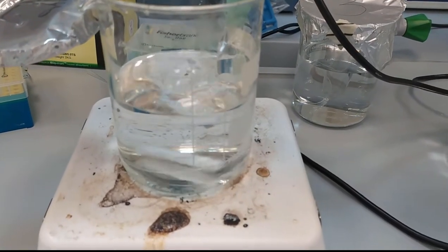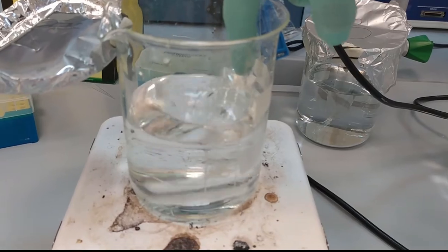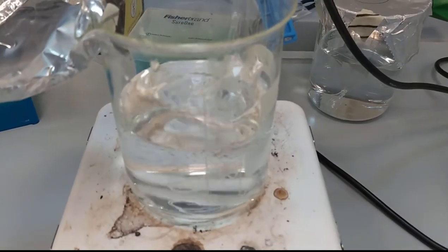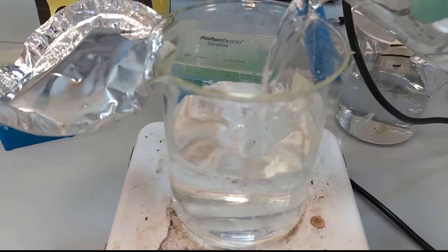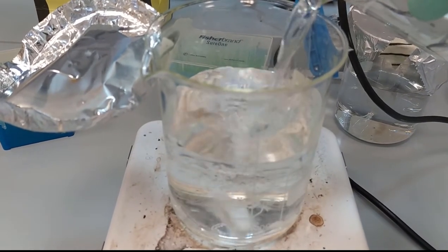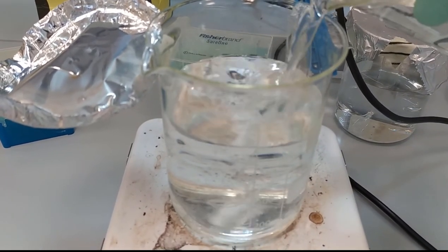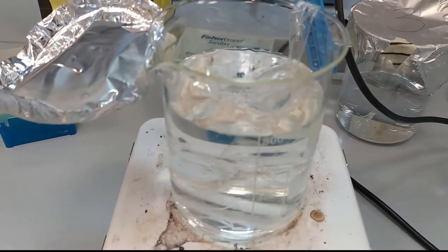As you can see, the semipermeable membrane is not soaked. That's why we need to add some more water, so that it is immersed totally. Now it's immersed totally.